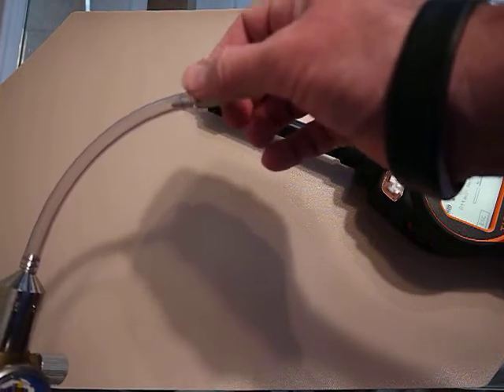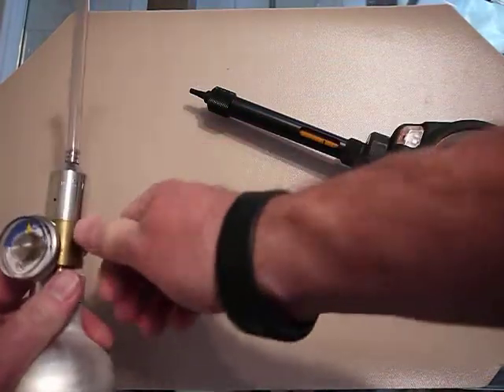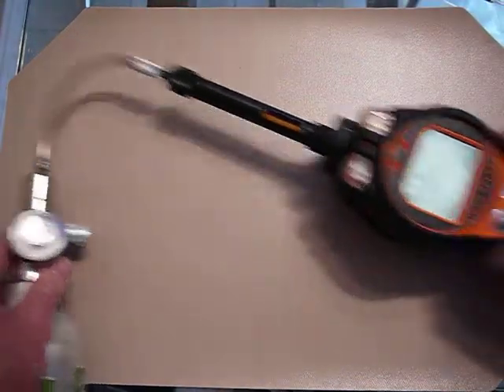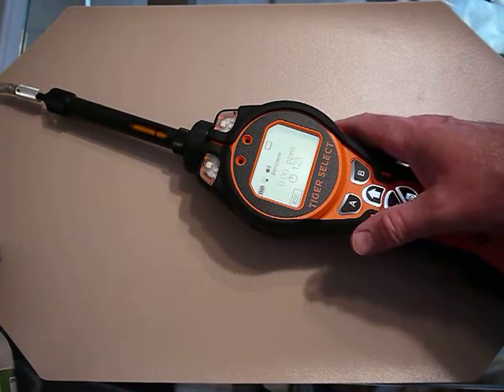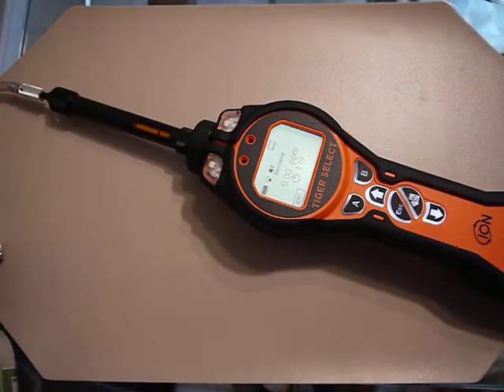There's a hole in the adapter that lets the excess gas come out, because you don't want to pressurize or force gas down the tube. I'll start the gas — I want to be in a fairly well-ventilated area. I hit start and it's going to take a reading, counting down from 120 seconds.